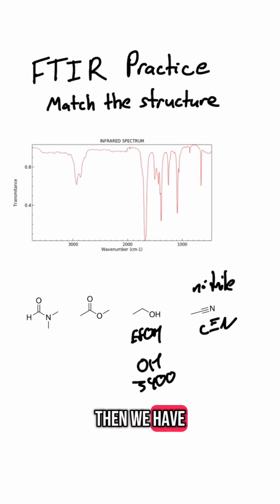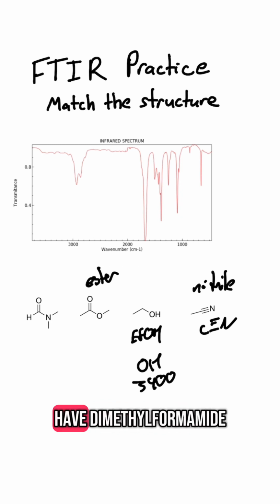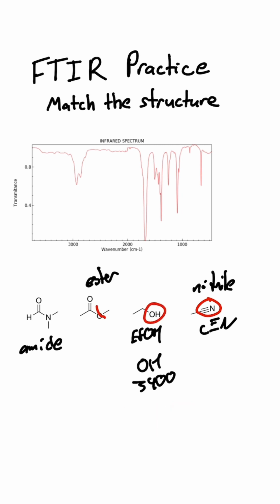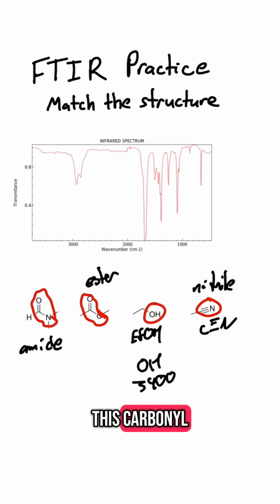And then we have methyl acetate. I don't have enough room to write these names, but we have methyl acetate right here. I'm just going to say ester because it is an ester. That's what we really want to look at. And then we have dimethylformamide, which, for intents and purposes, we're going to call an amide, even though it's a mix of an aldehyde and an amide, essentially. But it's more amide, so we're going to call this amide. It's a formamide. I'm going to circle the points that you want to be worried about with these. So you'd be looking for this carbonyl, and this carbonyl.